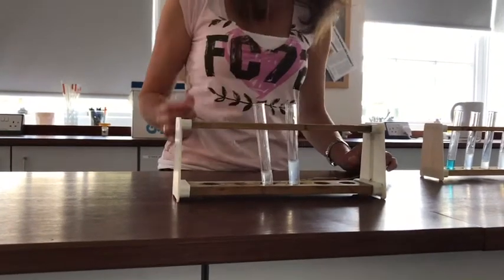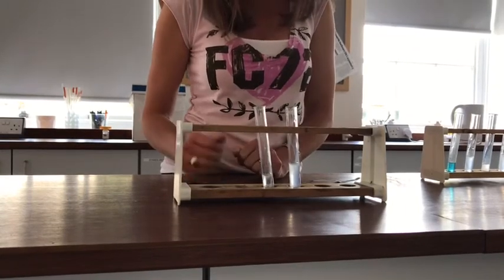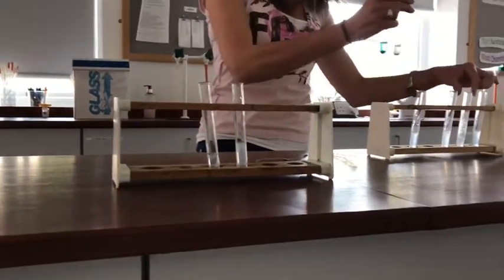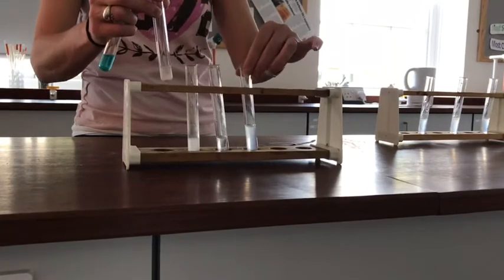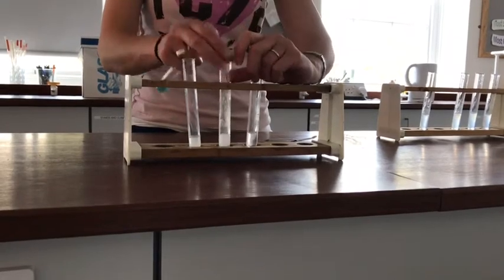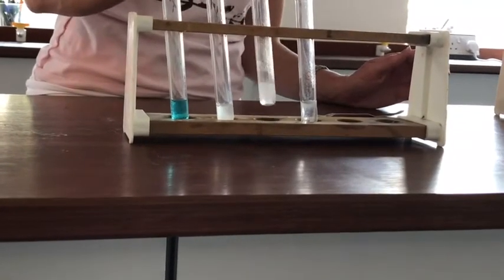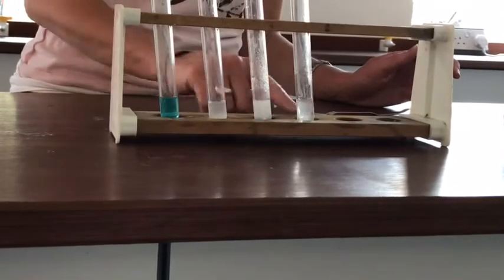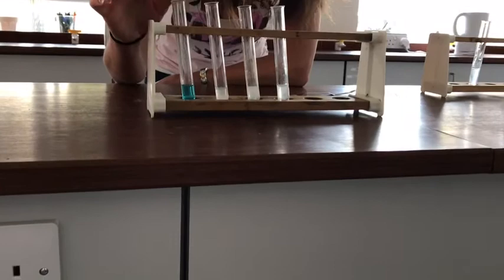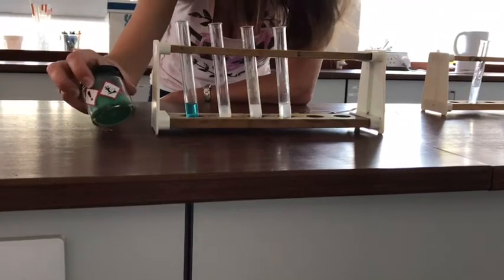I hope that's very nice convincing proof that carbonates and acid do in fact make carbon dioxide, and alongside it they should make water and a salt. And if I look at the tubes that I've got left, you can see some of them have got some residue that didn't manage to dissolve, but some of them we can see the liquid has changed colour ever so slightly as some of that salt is remaining in the solution. So this one would have actually made copper chloride from the copper carbonate and the hydrochloric acid, and it's got a very nice distinctive bluish colour to it, even though the original powder was green.